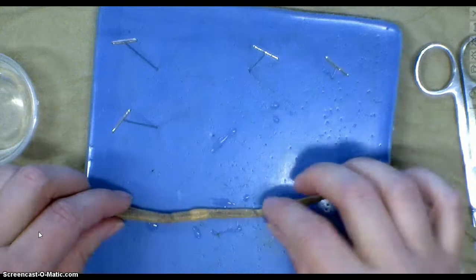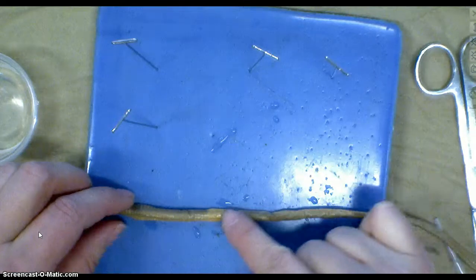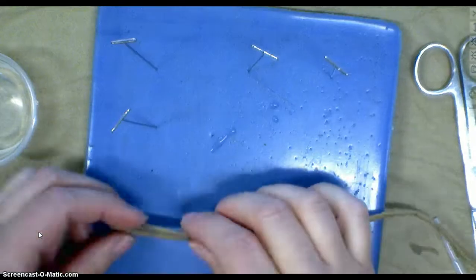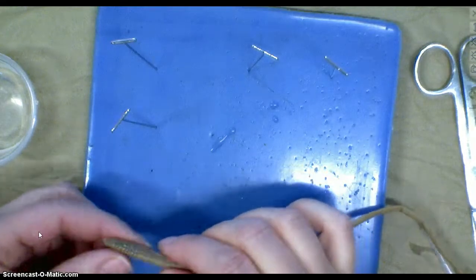So when we go to open him up, we won't be opening up that end anyway, but we'll need to make sure that we're laying him straight because he is a bit twisted here at the front.